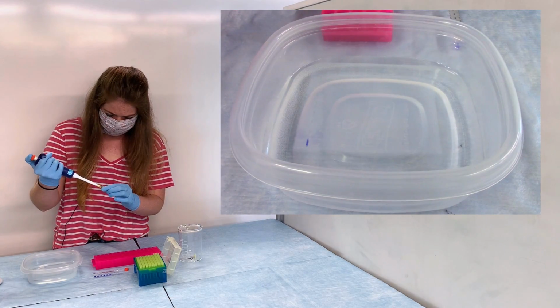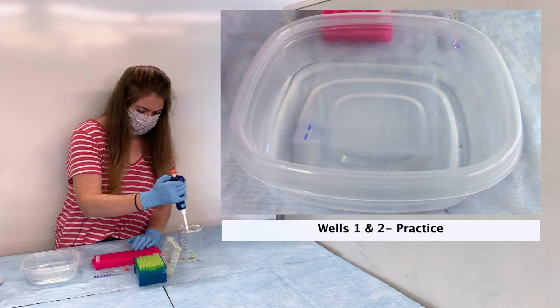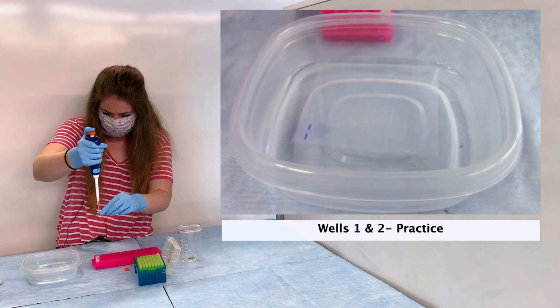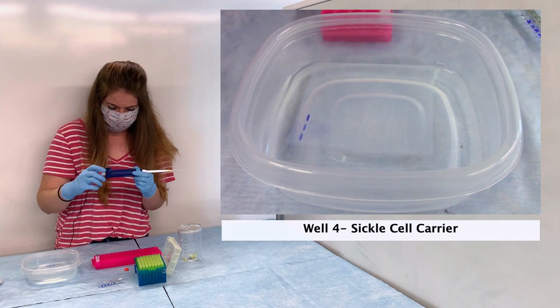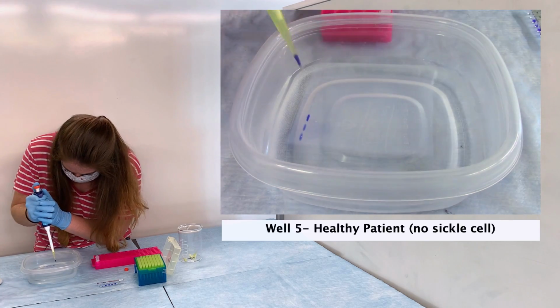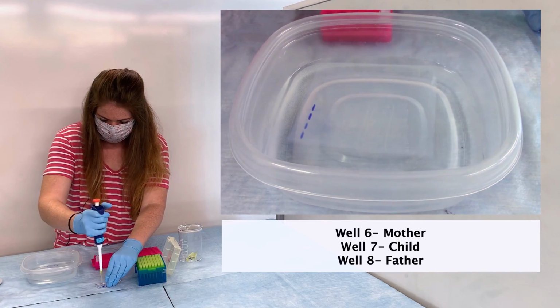I'm going to repeat this process 7 more times to fill the other 7 wells. Remember, the second well will also contain practice dye. Well 3 will contain DNA from a sickle cell patient to serve as control. Well 4 will contain DNA from a patient carrying, but not expressing, sickle cell. Well 5 will contain DNA from a healthy individual that does not have sickle cell. And wells 6, 7, and 8 will contain DNA from the mother, child, and father, respectively.